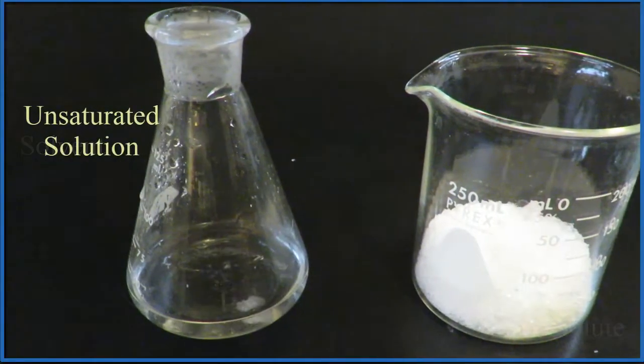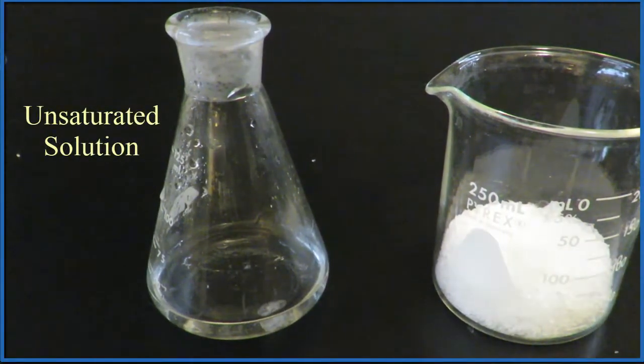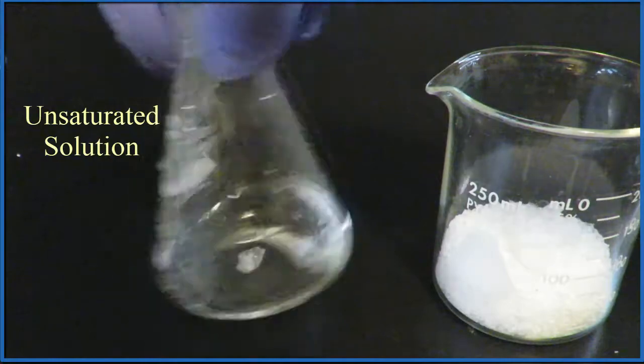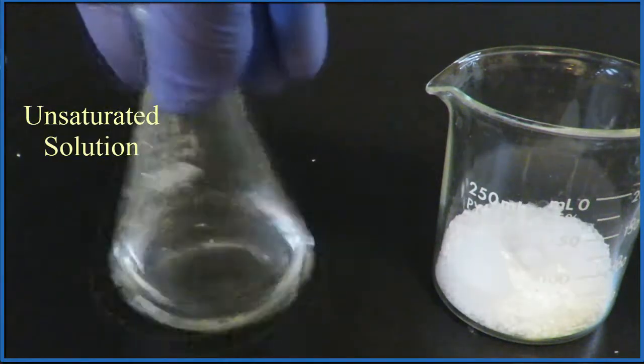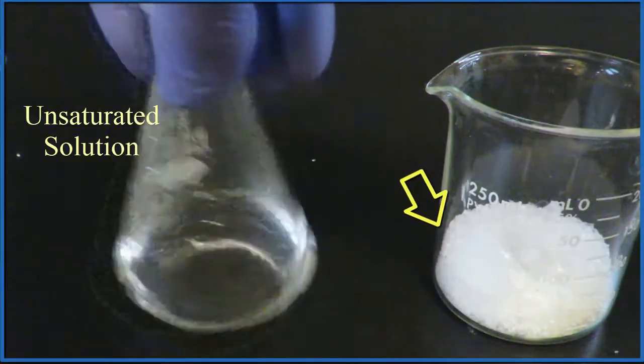This is an unsaturated solution since we can keep dissolving more of the solute, more of these crystals. The crystals that we're using here are called sodium acetate, and everything in that beaker, ultimately it's going to dissolve.